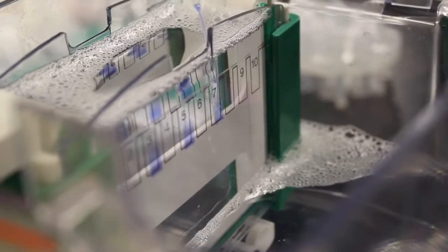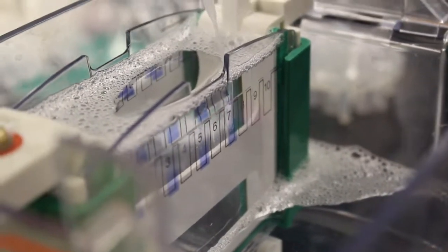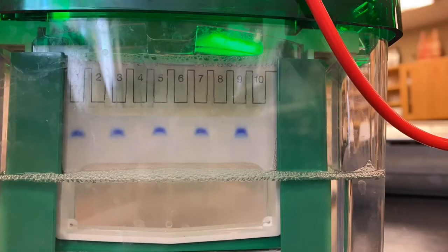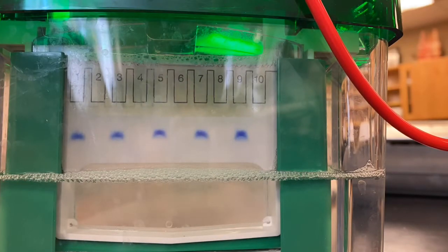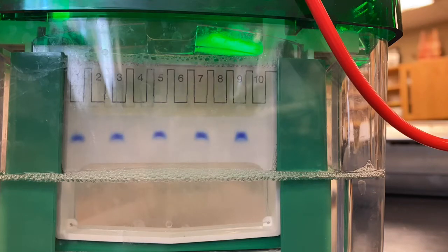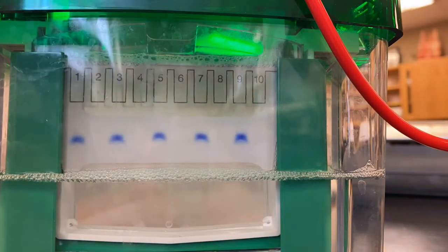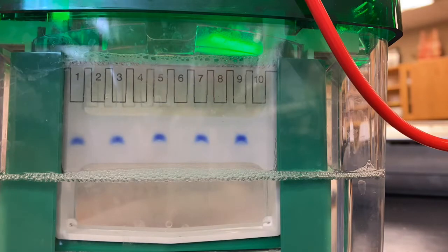Here is a representation of us loading the wells with 50 microliters of solution. Here is a time lapse of our samples descending within the acrylamide gel. During acrylamide gel electrophoresis, negatively charged protein samples are pulled by an electric current towards a positively charged electrode at the bottom of the chamber.